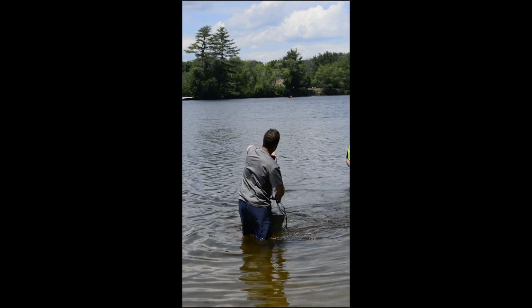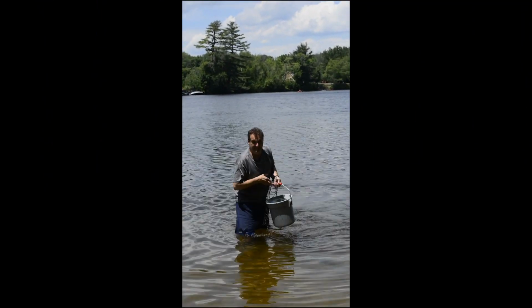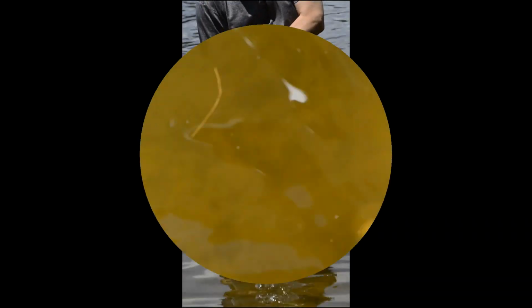Okay, we're doing clean sampling. A lot of folks, when they go out and sample, will throw a bucket, and the bucket drags across the surface. You can see blades of grass, pieces of pollen, and this is what they pick up when they drag the bucket back or when they use their beaker.